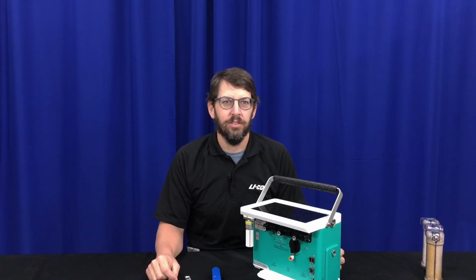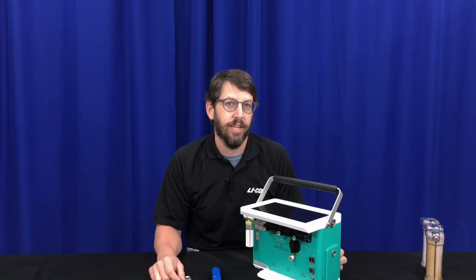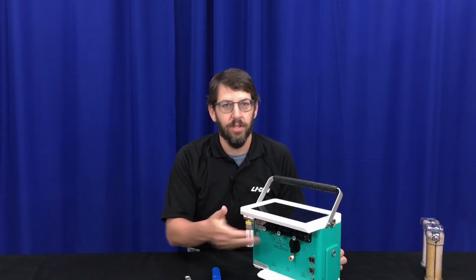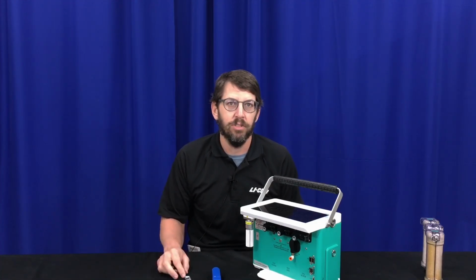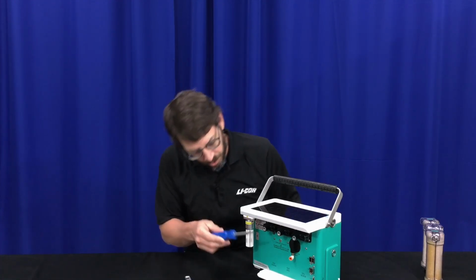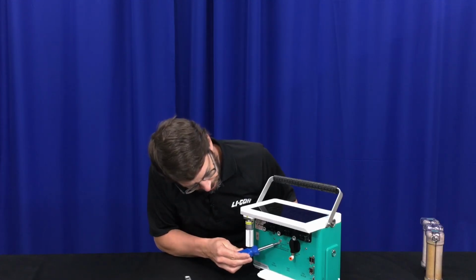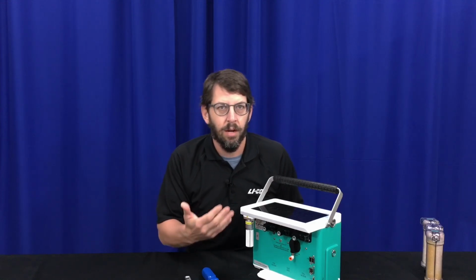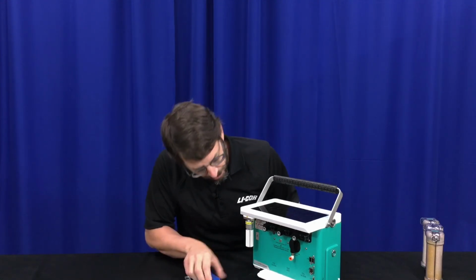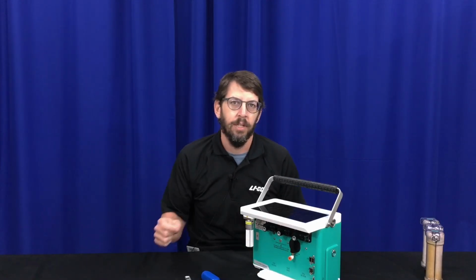I'm a senior scientist at LI-COR, and in this video we're going to talk about supplying preconditioned gases to the inlet of the LI-6800 console. There are two options for doing so. One is the auxiliary air inlet, which is located right here. The other location is prior to the filter at the bottom of the filter cover, which is right here, noted by this hose barb here.